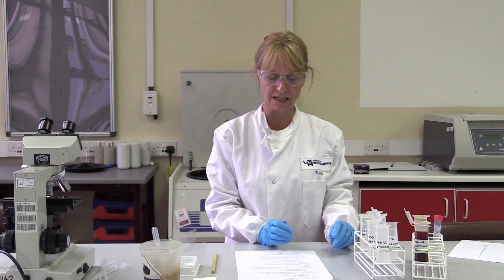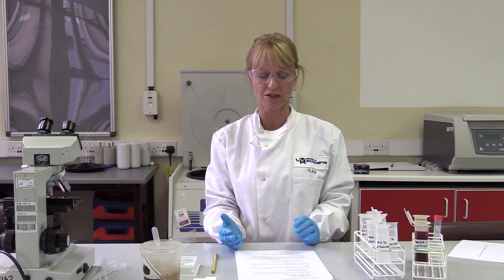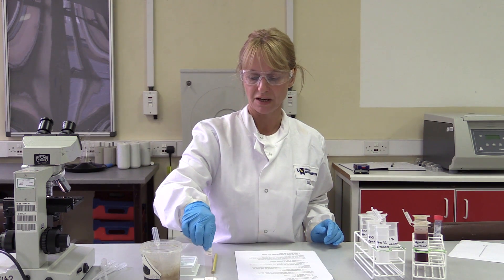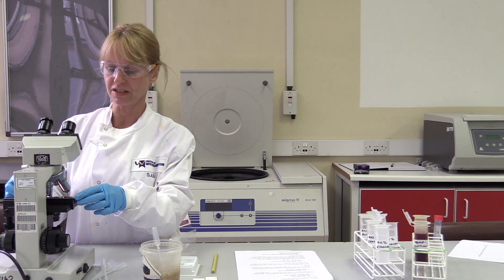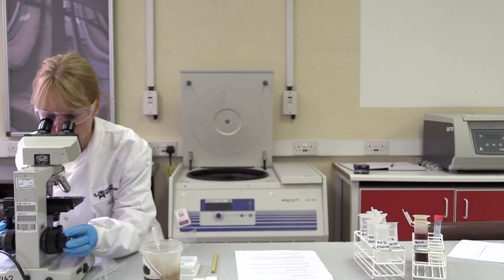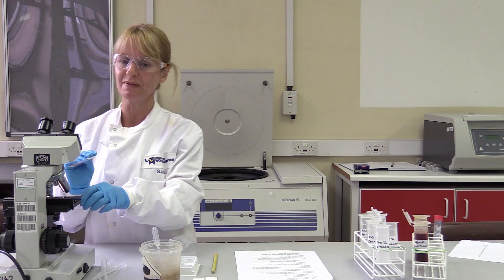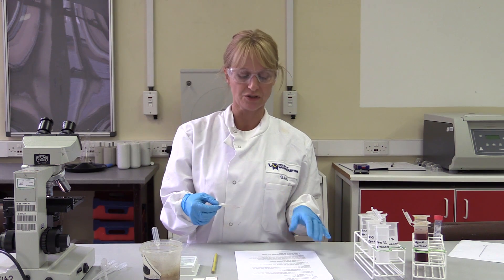Then wash it in tap water — it's at this stage you need to look at the slide under the microscope to see what the haematoxylin is doing to the cytology sample. Make a note of what you see. Make sure your microscope is set up ready, take your slide out, wash it in tap water, and look down the microscope to see what has happened to the cells. Record that and then carry on. Don't take too long at this stage because you don't want the slide to dry out — make sure it's still covered in fluid before moving to the next step.